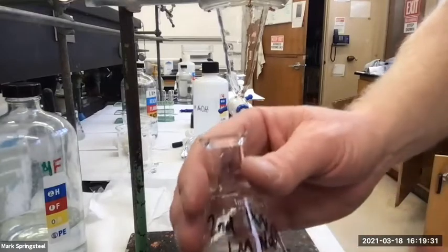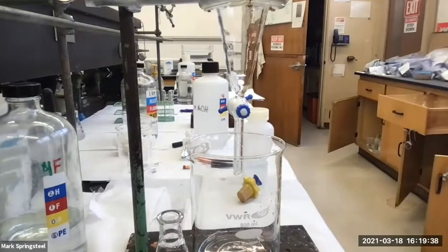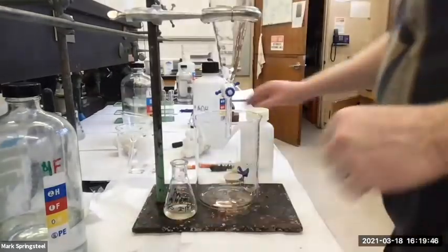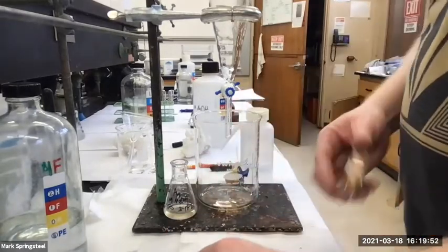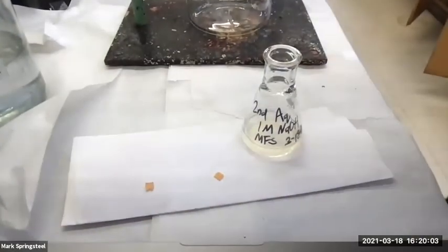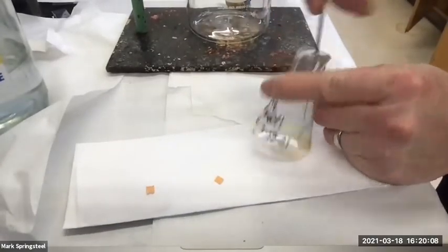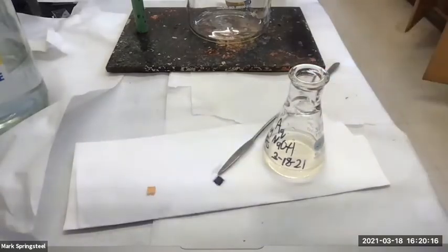All right, so here's my aqueous layer. Should it be acidic or basic? Should be basic, right? Yes, 1 molar sodium hydroxide should be basic. Why don't we check just to make sure before we switch it? I'll get just the little bits of pH paper. Get the spatula. And I'll stick it in there, swirl the spatula around good, make sure it's nice and coated, and check it. Is it basic? Yep. Definitely basic. Okay, looking good.